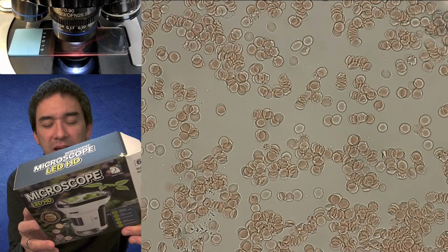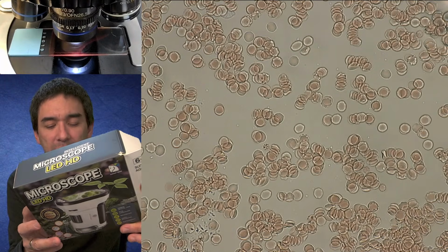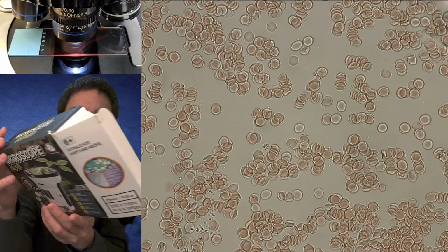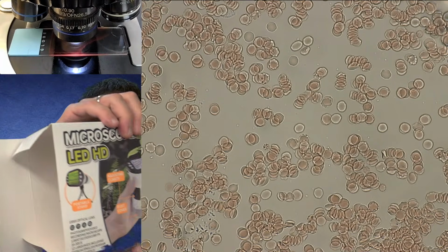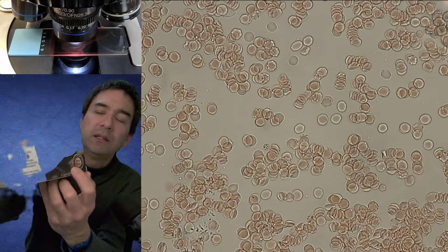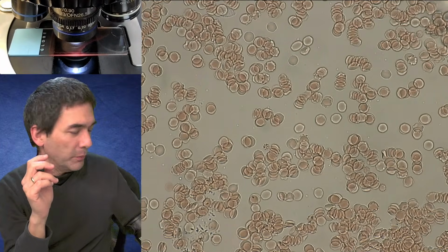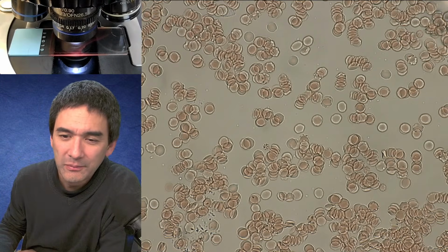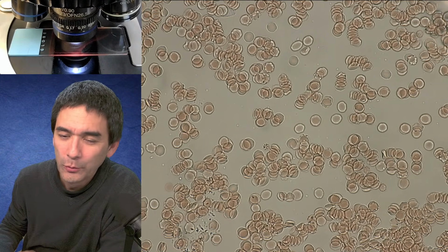This is the thing that kind of disturbs me a little bit. I need to tell you that. It says here 200 times and 1,000 times magnification. Don't even get me started on this topic. Okay, no comment.